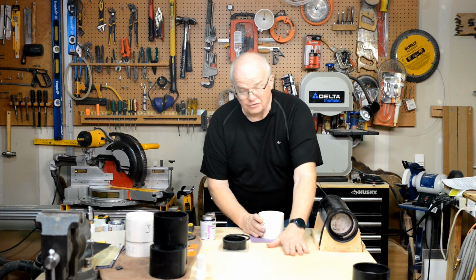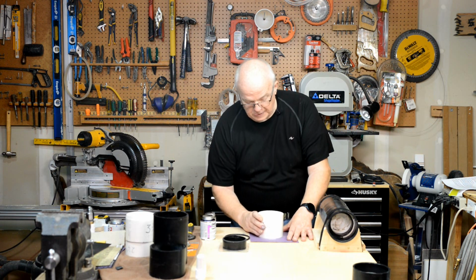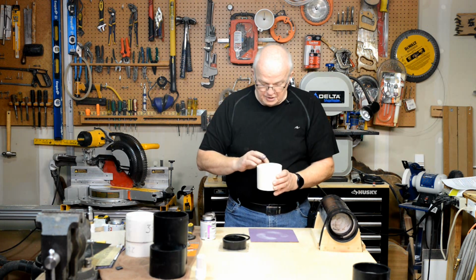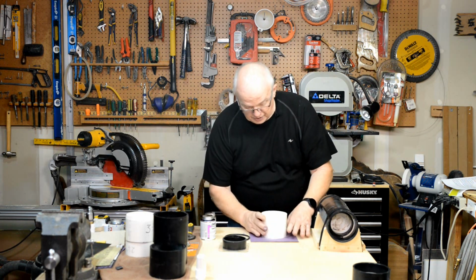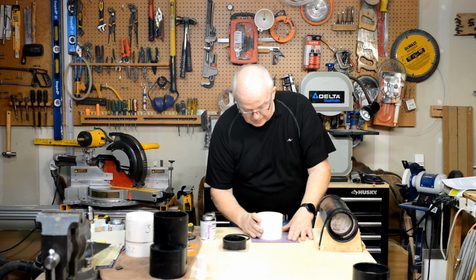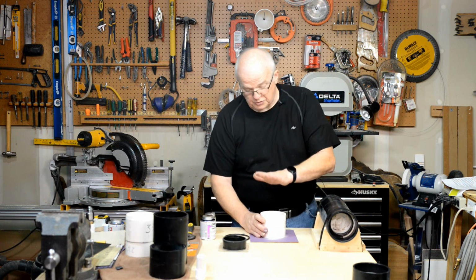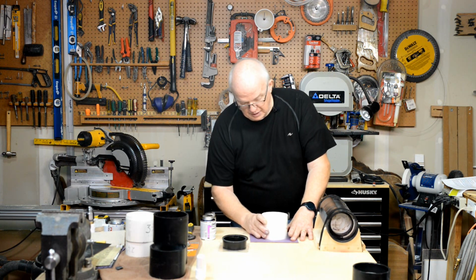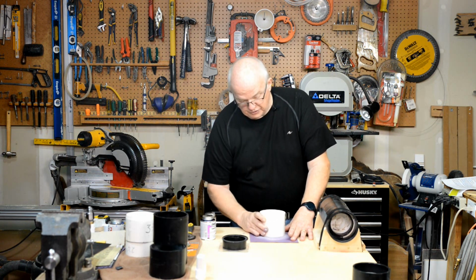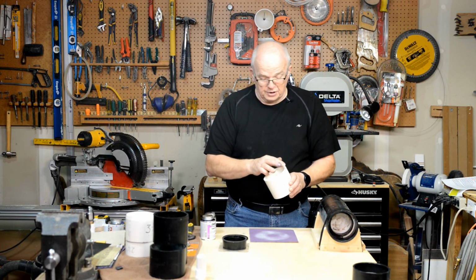But make sure you have a flat surface, piece of sandpaper, and you can move this around on it until it is completely smooth. And that is completely smooth. I'm fairly satisfied with that. Just a little bit more. Try not to lean one way or the other. Don't put uneven pressure on it. You want the pressure to be straight down, and that will work to remove any saw marks that you might have on it, and that feels really good.